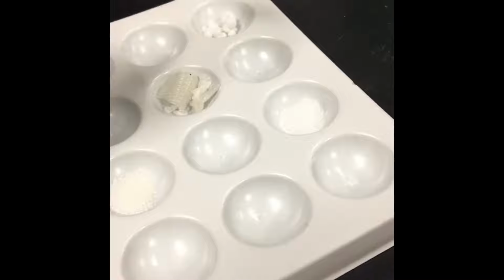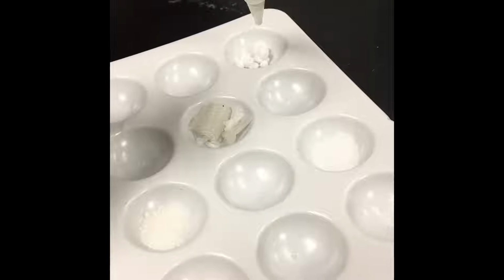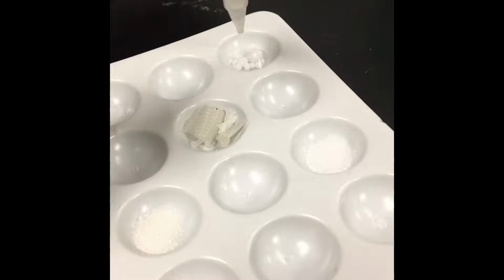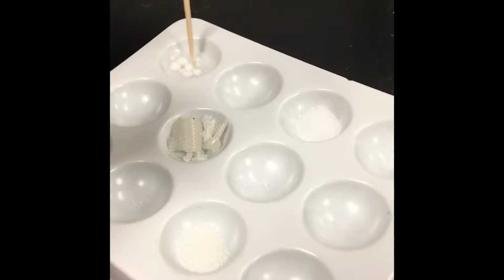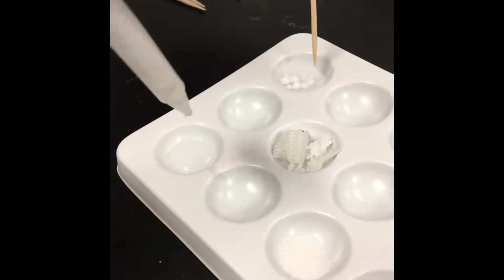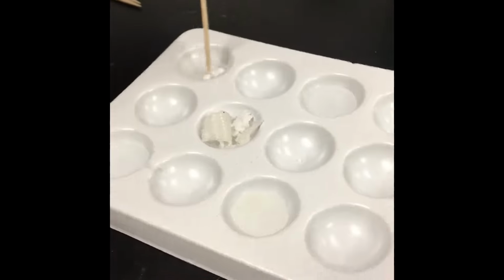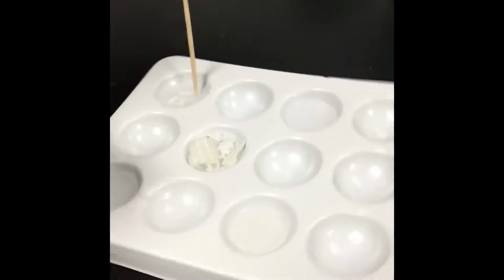Okay, so next we're going to do the solubility in water test, and my wonderful assistant Casey is going to squirt some water into each well. So the first well is the calcium chloride. Go ahead, Casey. And she's going to squirt some water in there and work on dissolving that. Go ahead and squirt water in all of them there, Casey. So this one's going to be the citric acid, and the wax is getting some water, and that's the sodium chloride, and that is the sucrose getting some water. So Casey's going to work on stirring these and see if they dissolve. We're testing to see if they are soluble. If they're soluble, they do dissolve. And we will come back to check on them after she has stirred.